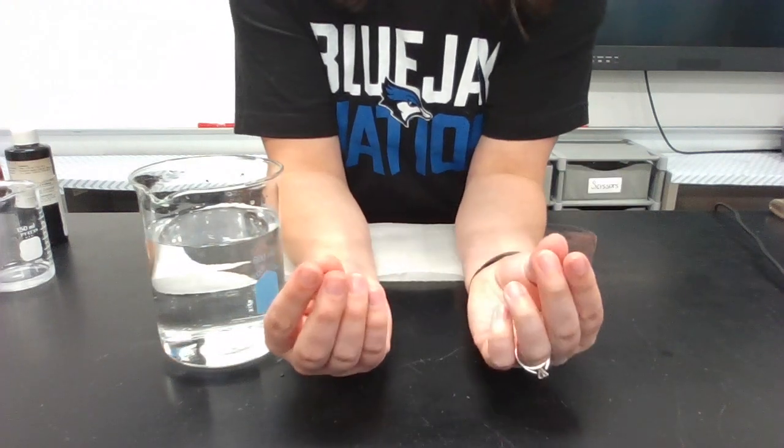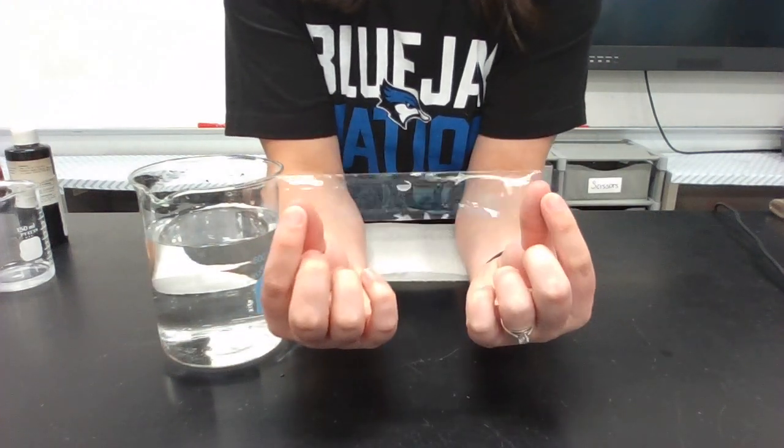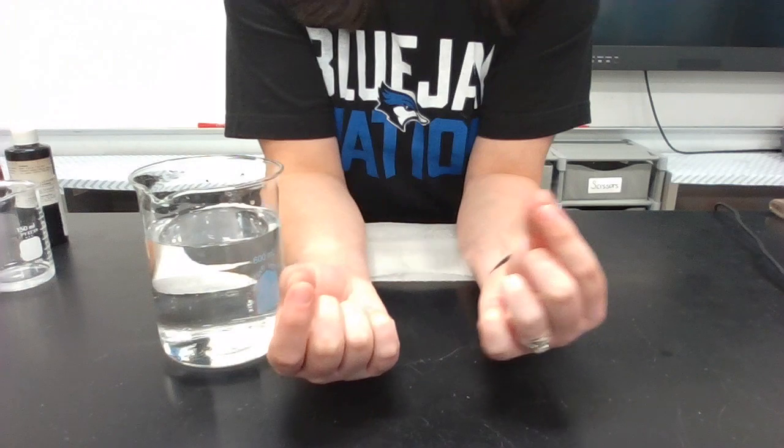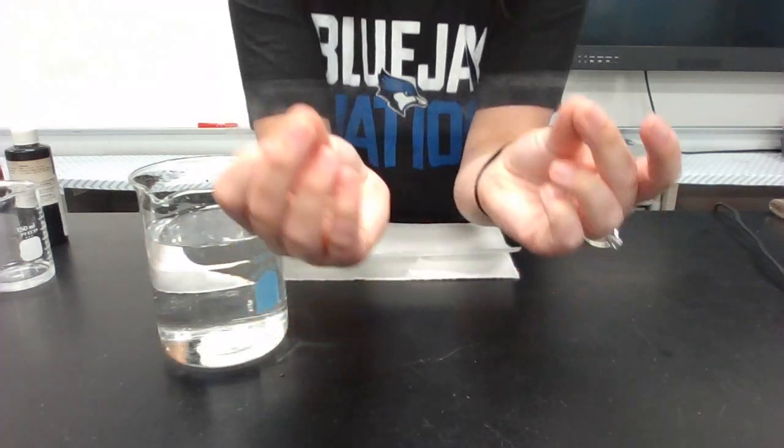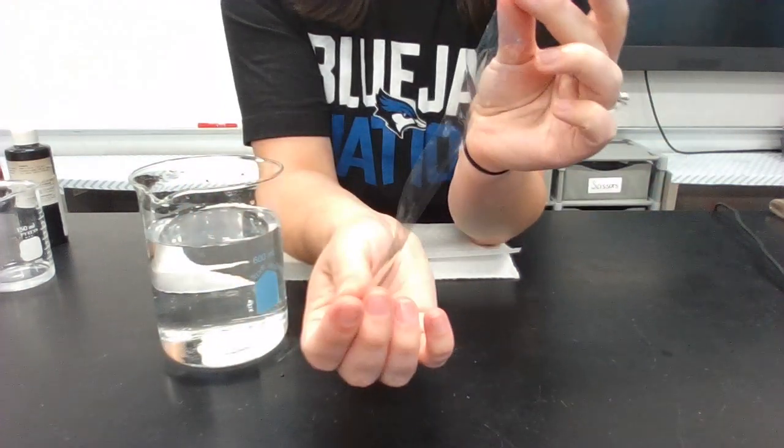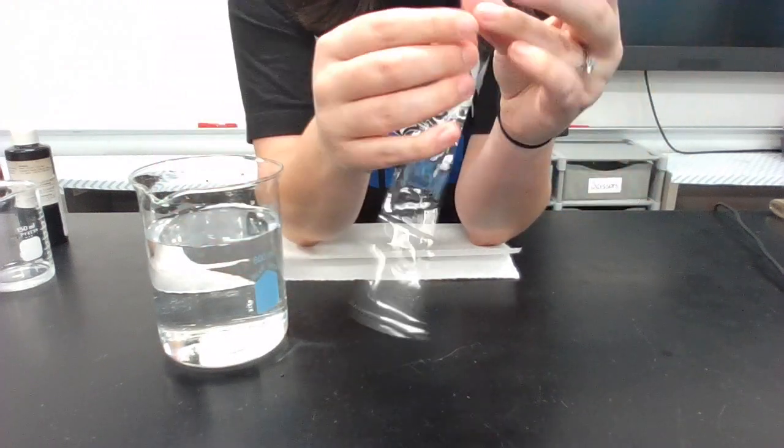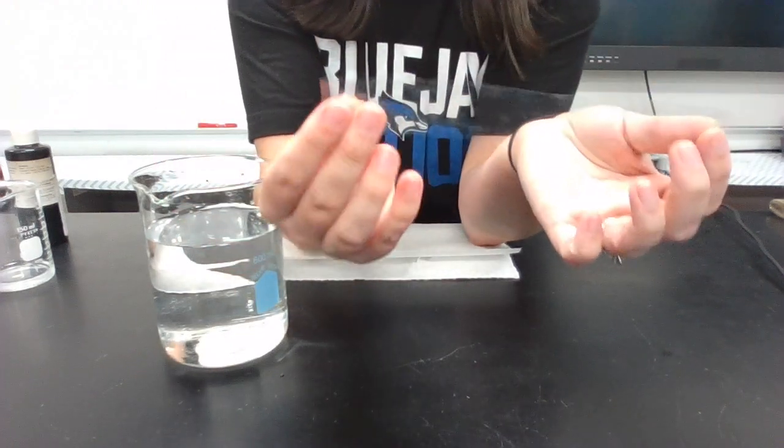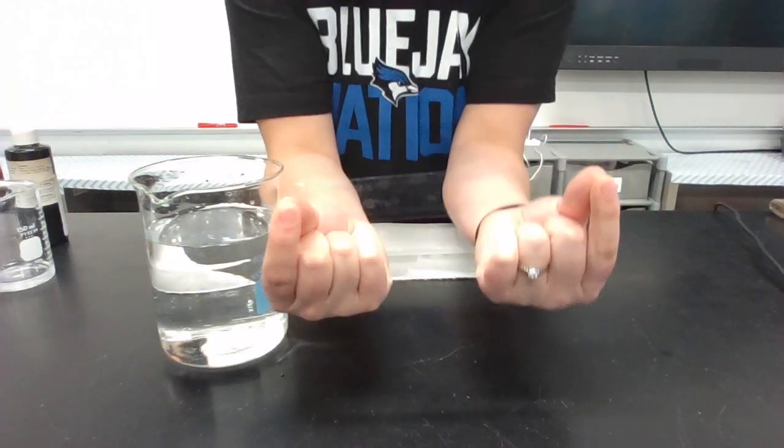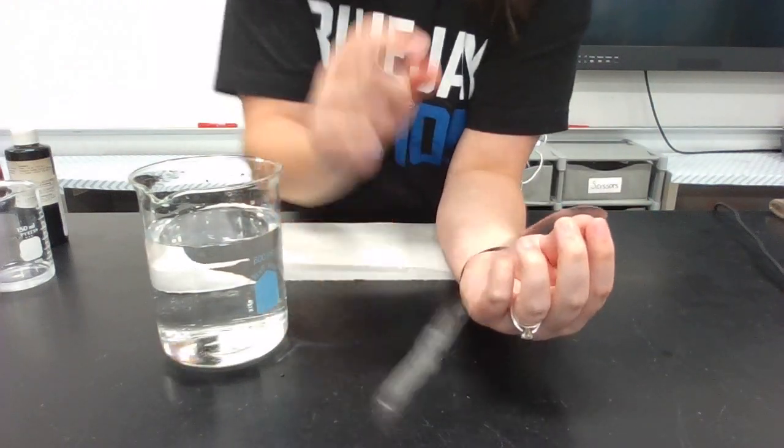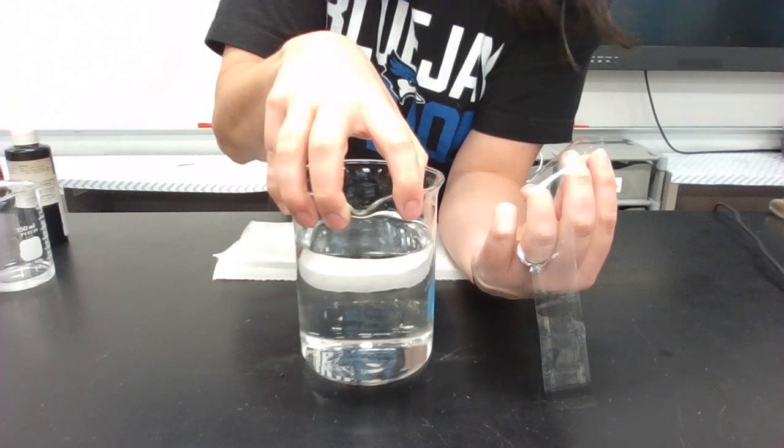So we take all the blood out, filter it using this kind of tubing, and then pump it back into your body. So there are tiny holes all throughout this tubing. Also, at either end, it's open right now, and that's important because in a minute I'm going to tie it off.